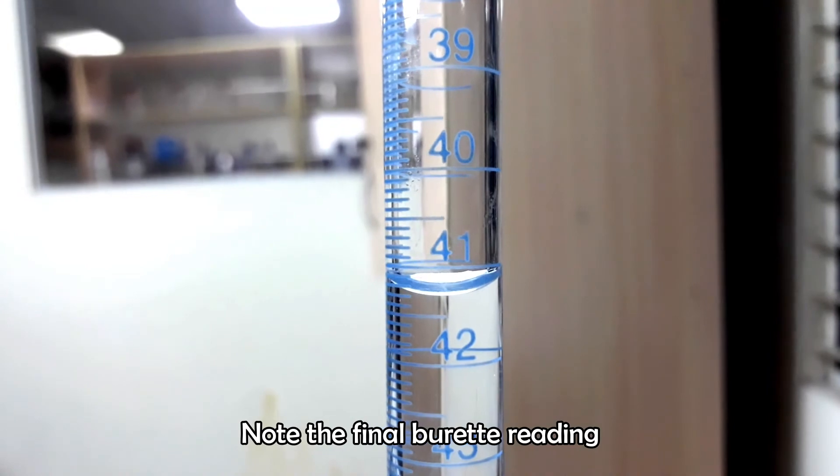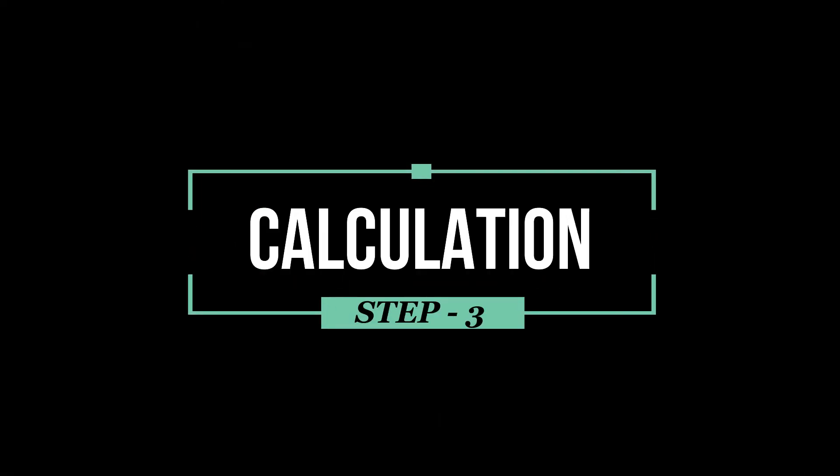Note the final burette reading. Now we are in the last step.